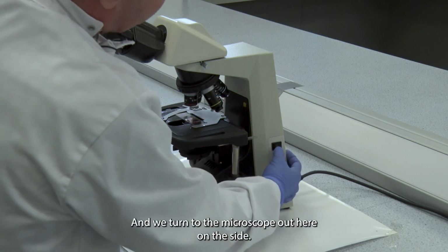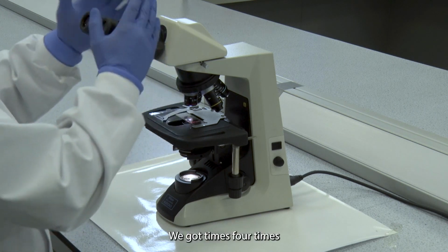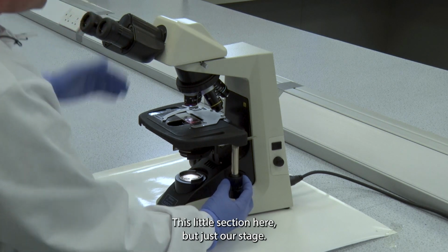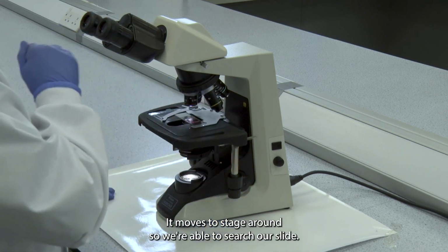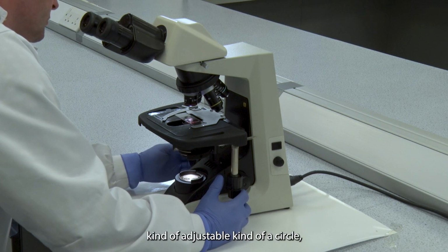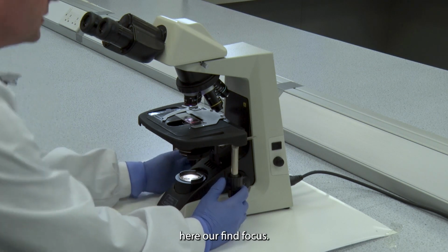And we turn the microscope on here on the side, and we've got times 4 times 10, which is times 40 magnification. This little section here adjusts our stage. It moves the stage around, so we're able to search our slide. These two adjustable circles here are our fine focus.